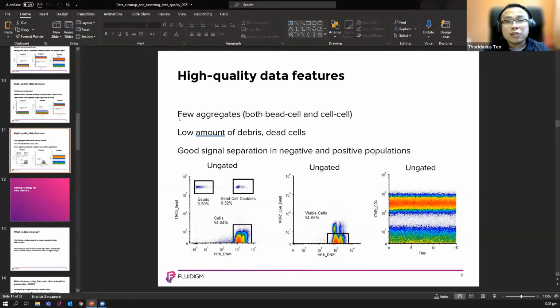Yeah, just let me answer a quick question from Key. Remember that we wanted to hear some questions, just a very short one, if I may. So Key, if you could see my screen, you were asking how do you know they are high quality data. When it's high quality data, you see there are few aggregates, both doublets and clumps of cells. It's very low, very few aggregates. There is also a low amount of dead cells. And finally, they have good signal separation between positive and negative populations. You can see that right here with a good signal, and you should know by here that your data quality should go. All right, I hope I answered your question in regards to this area. A quick look, a quick QC check, before we start putting it into data analysis.